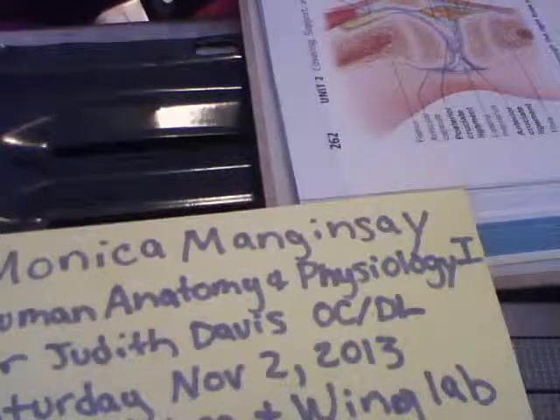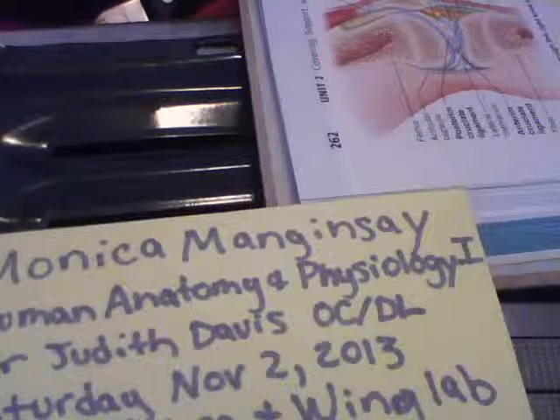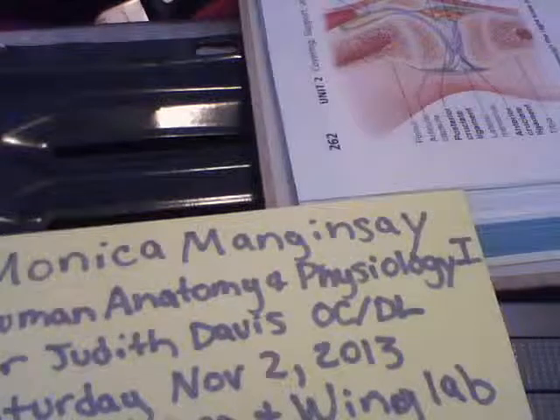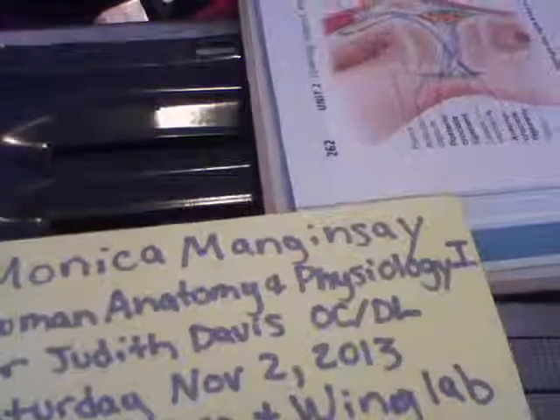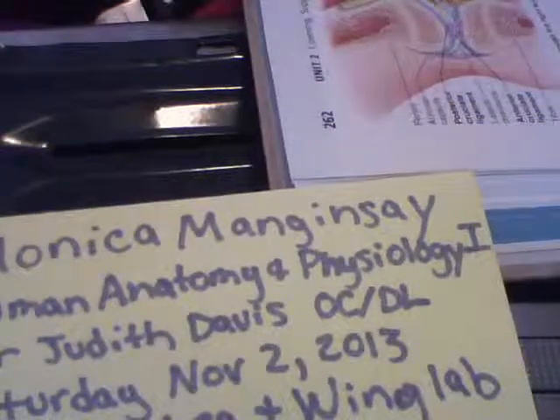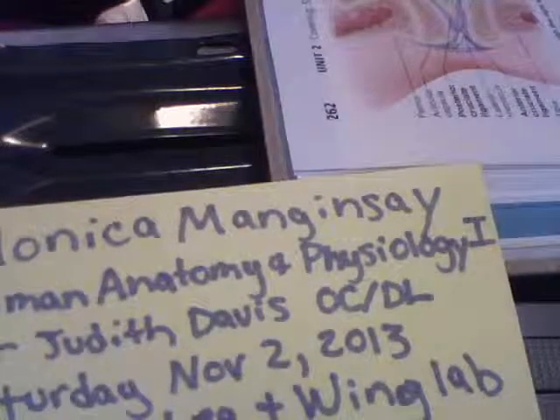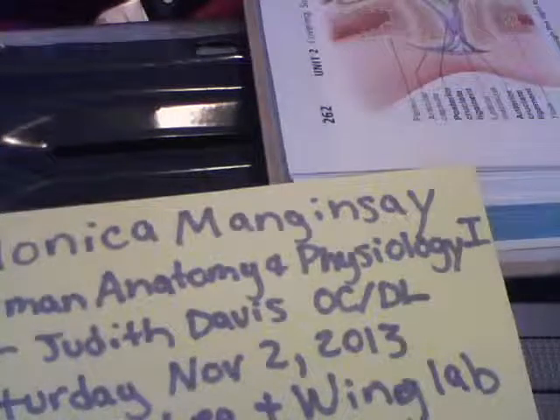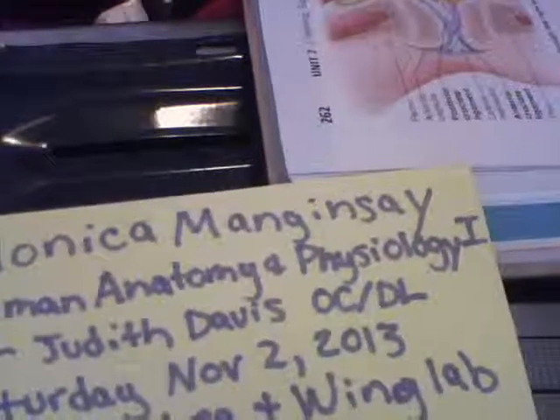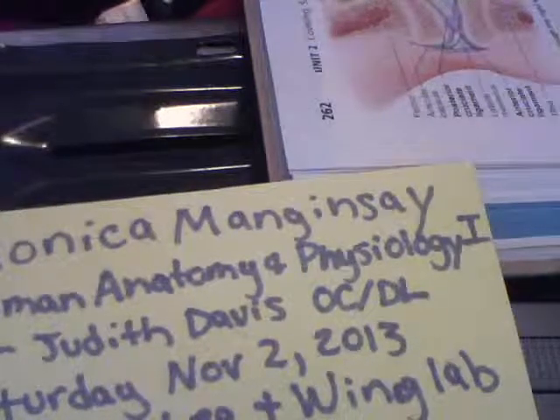Anteriorly, where the capsule is absent, 3 broad ligaments run from the patella to the tibia below. These are the patellar ligament, flanked by the medial and lateral patellar retinacula, or retainers, which merge imperceptibly into the articular capsule on each side. The patellar ligament and retinacula are actually continuations of the tendon of the bulky quadriceps muscle of the anterior thigh. Physicians tap the patellar ligament to test the knee jerk reflex.